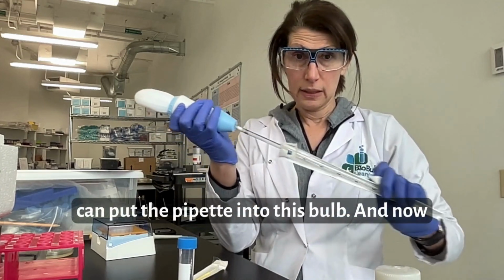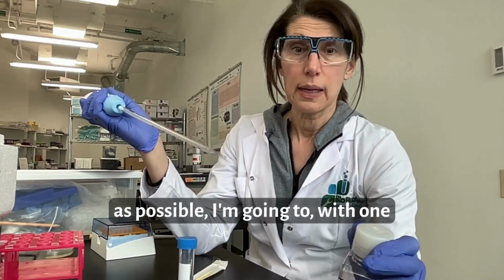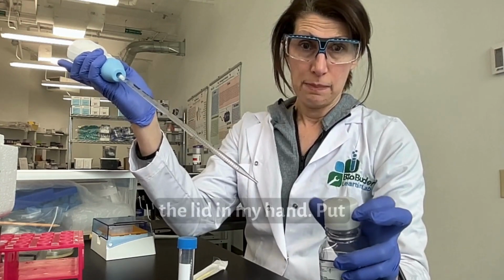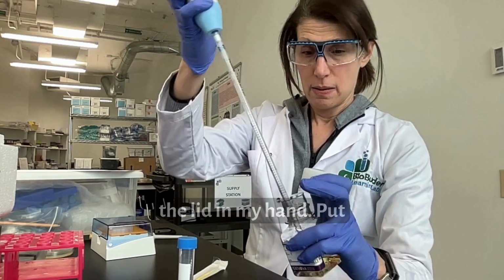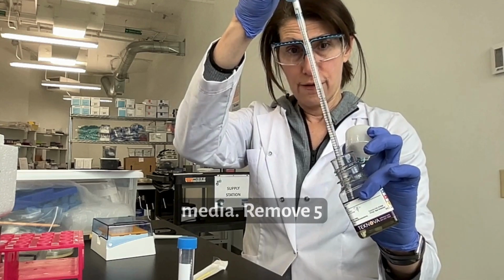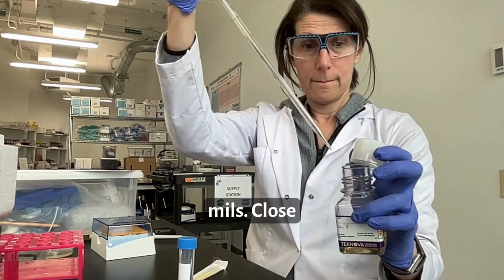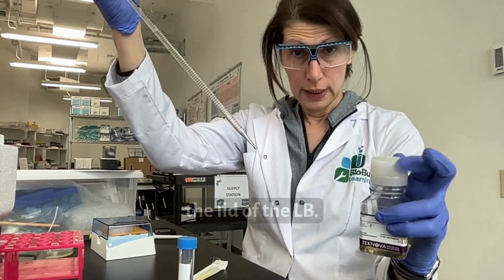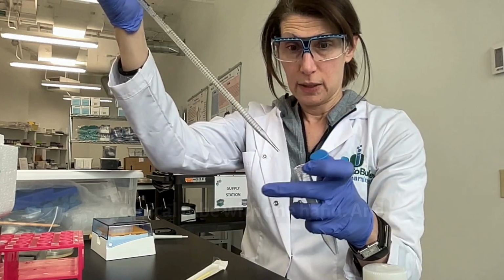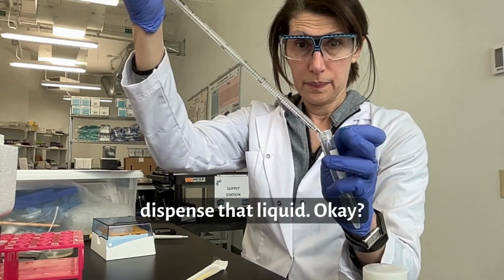I can put the pipette into this bulb, and now with this open to the air as briefly as possible, I'm going to, with one hand, open this bottle, keep the lid in my hand, put the sterile tip into the liquid media, remove 5 mils, close the lid of the LB, open the lid of my 15 ml conical tube with one hand and dispense that liquid. Okay?